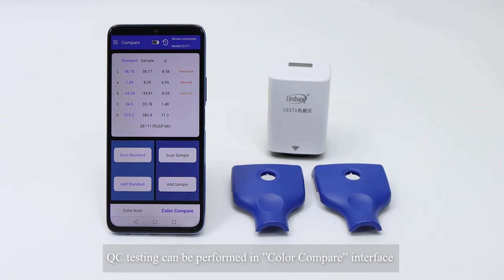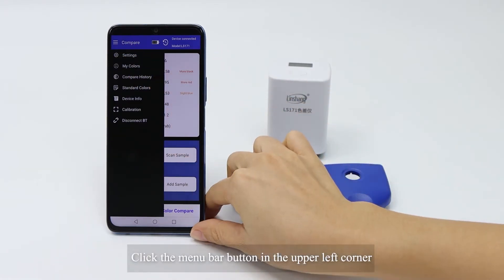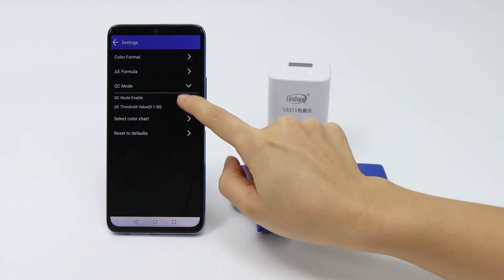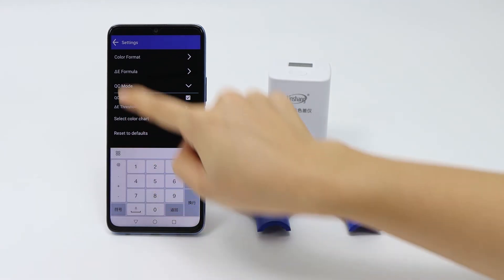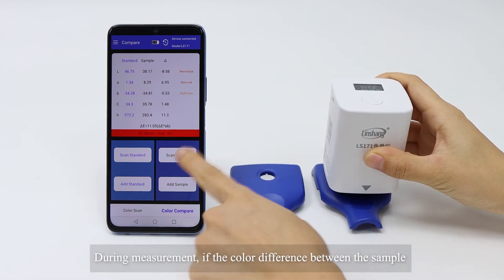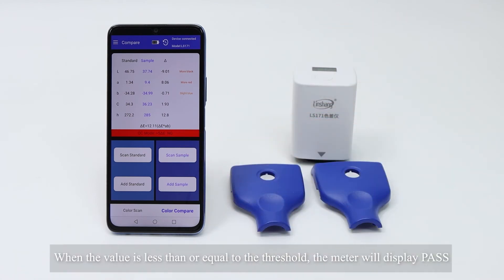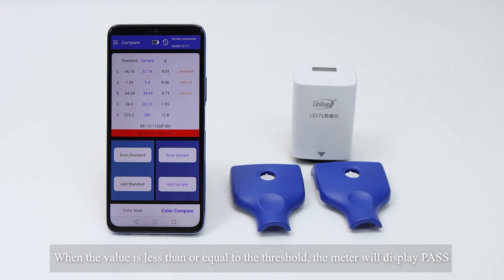QC testing can be performed in the color compare interface. Click the menu button in the upper left corner, then click Settings. Set the value to enable QC mode. Click QC Mode Enable and set the threshold value. During measurement, if the color difference between the sample and the standard is greater than the threshold, it will display NG. When the value is less than or equal to the threshold, the meter will display Pass.